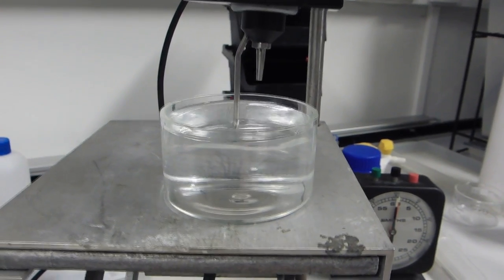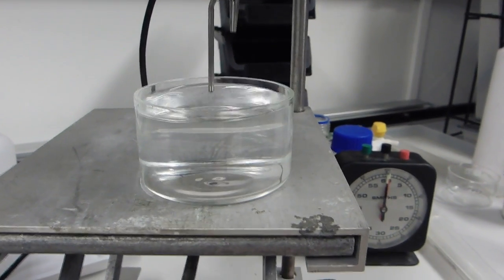With the measurement complete, we lower the stage and remove the sample before cleaning the probes.